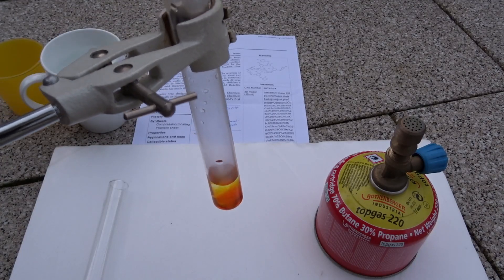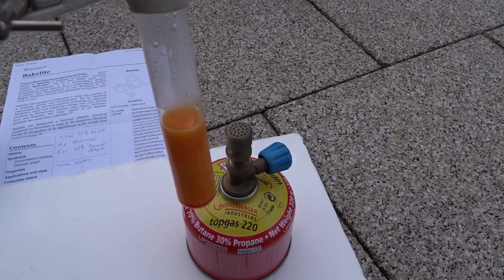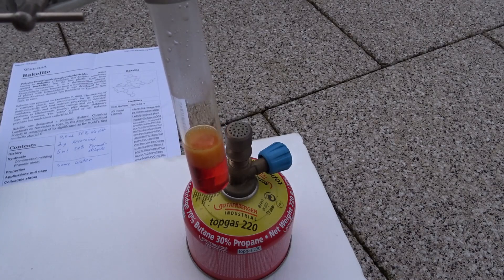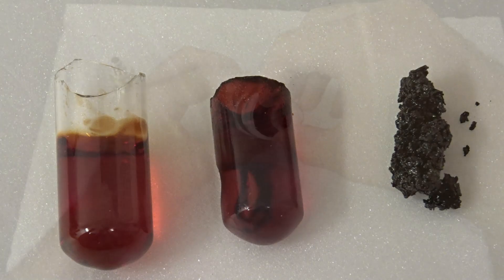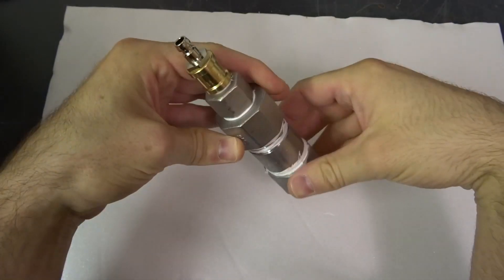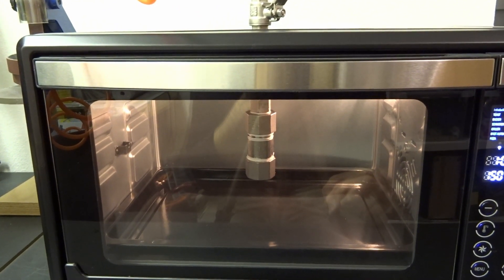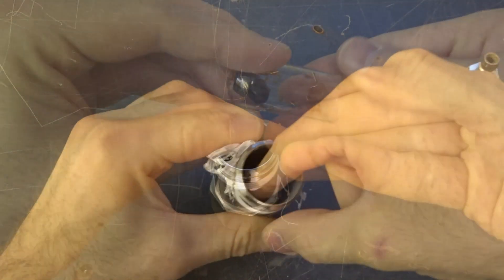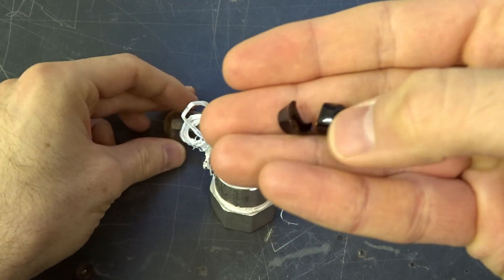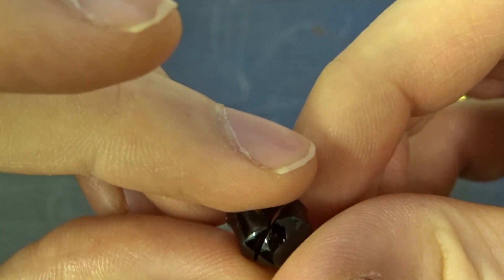Hello and welcome. In this little intro, you see me making Bakelite. And whilst you are enjoying this, it shows all the necessary steps from heating the reactants, to taking a look at the precursor, loading up the Bakelizer, setting up the reaction temperatures and pressure, and finally taking a look at the results — which aren't perfect but are a very nice example of Bakelite, as it's solid and most importantly there are no bubbles. It's nice and shiny.